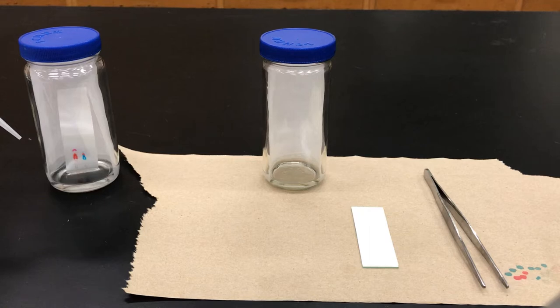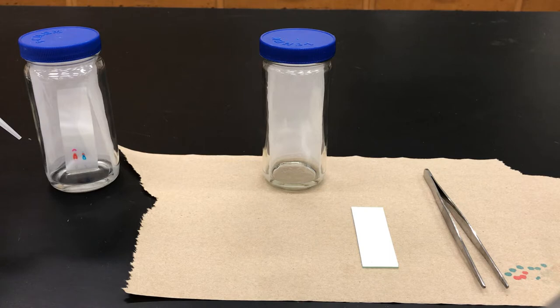Hi everyone, I'm Lisa Nichols and this is a continuation video. The previous one showed you how to run a TLC, and now we're continuing on. This one is going to be focused on how to visualize the spots after the TLC has run.